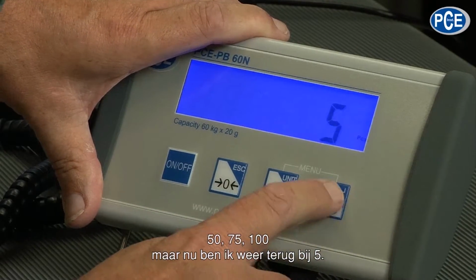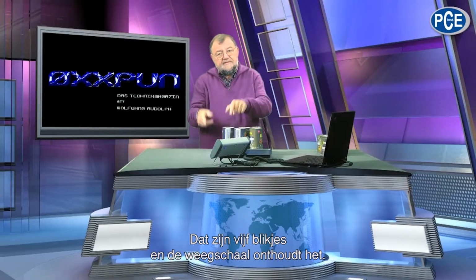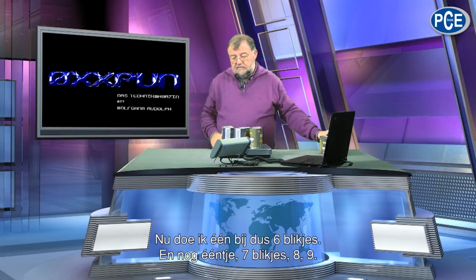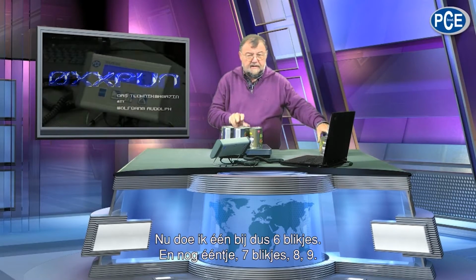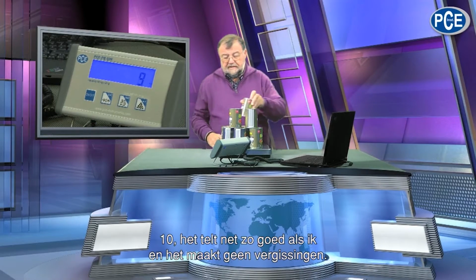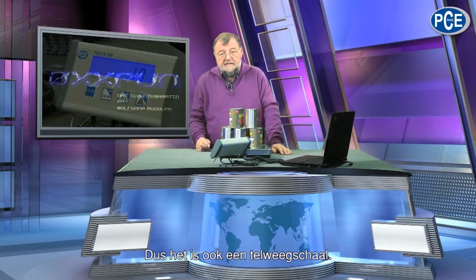So and now back to 5, and now I set it, and say OK. That are 5 cans, and the scale has remembered that. Now I put one more on it, so 6 cans, one more, 7 cans, 8, 9, 10. You can count just like me, but it doesn't miscount, so I also have a counting scale.